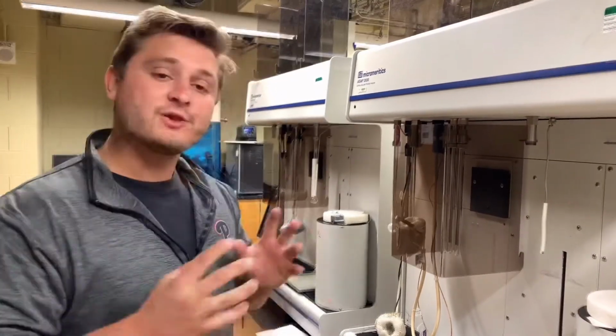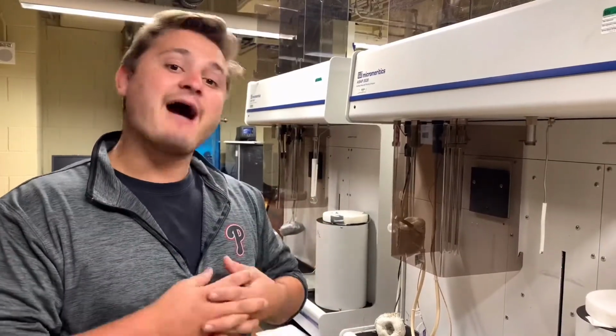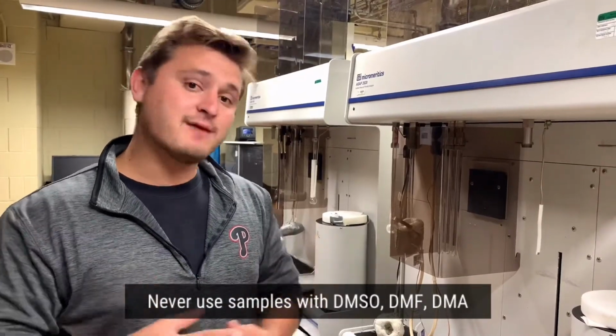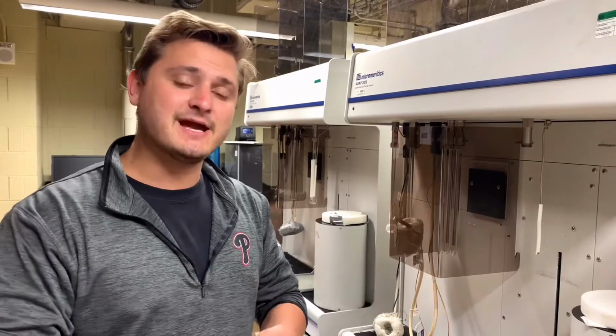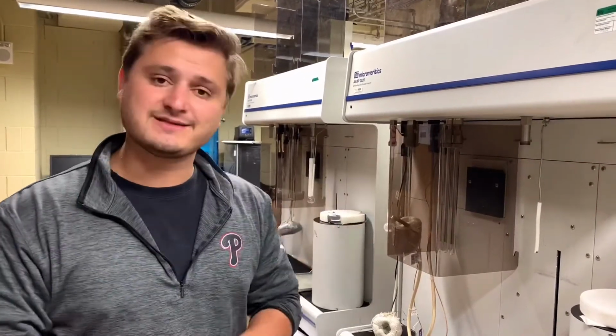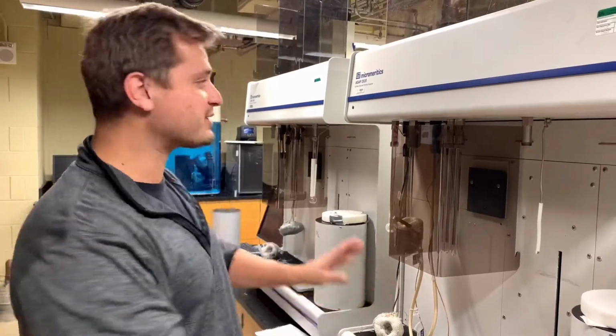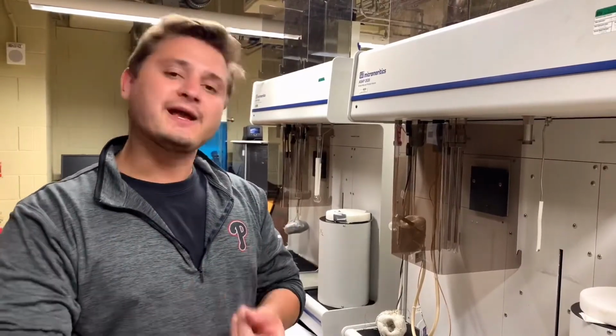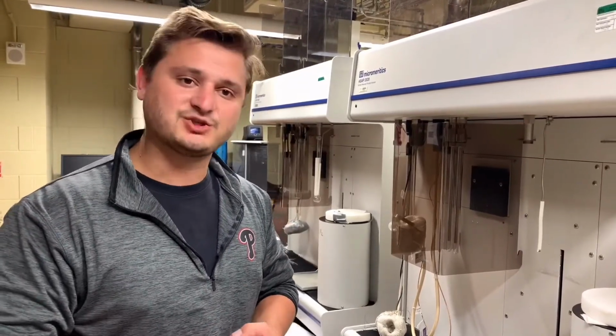The last thing is never, ever, ever have your last solvent be dimethylformamide, dimethylacetamide, or dimethyl sulfoxide, DMSO, DMA, or DMF. None of those should ever be the last solvent that was in your sample. One, that is to protect the instrument from those very, very corrosive and powerful solvents. And two, you will likely lose porosity from that activation, as those solvents are high surface tension solvents. You do not want those as the last solvent that was in your sample before activation.